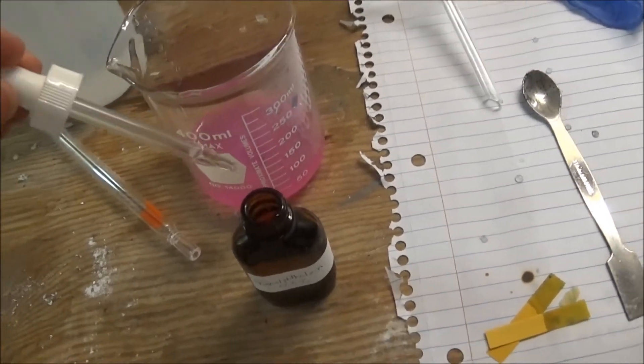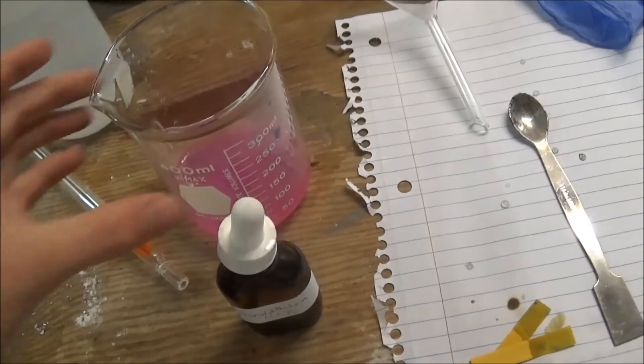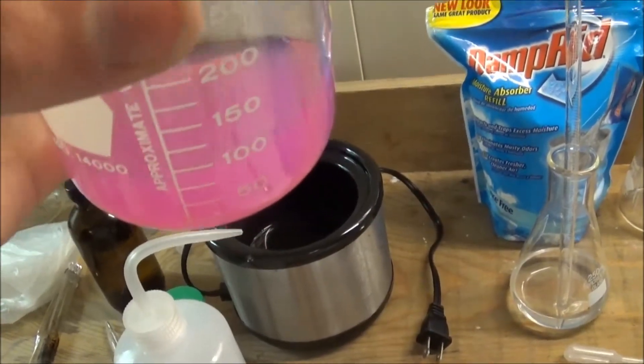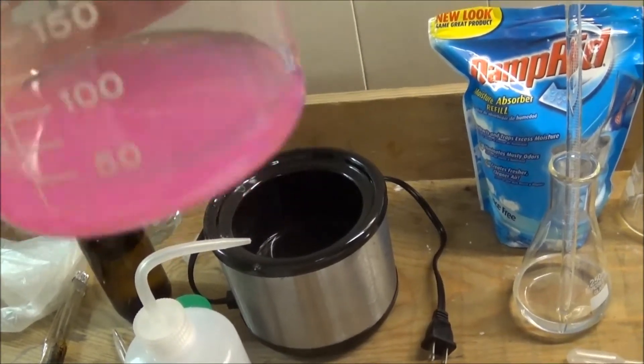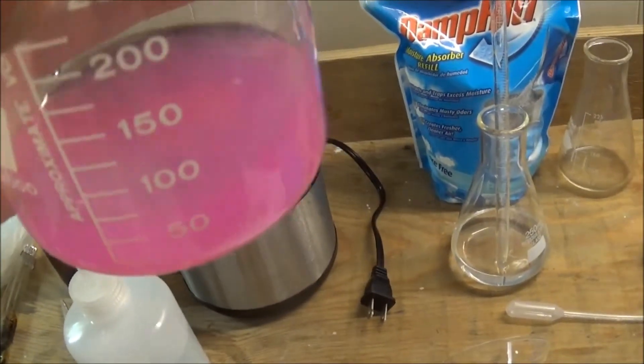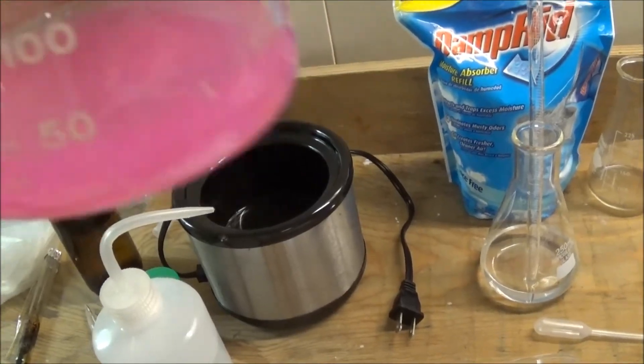As you can see the pH is certainly basic. I believe the transition for phenolphthalein is 8.2, so the water we have here is certainly basic.